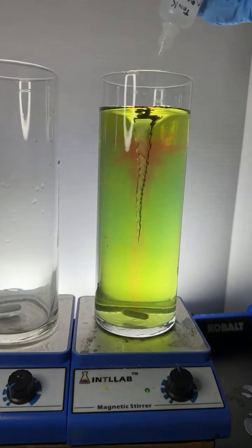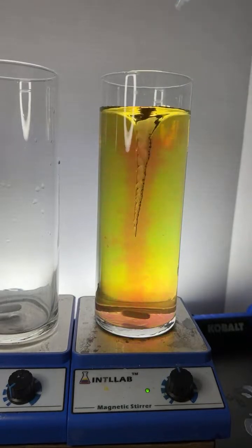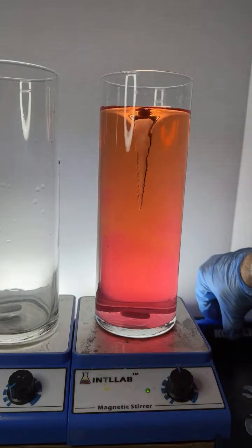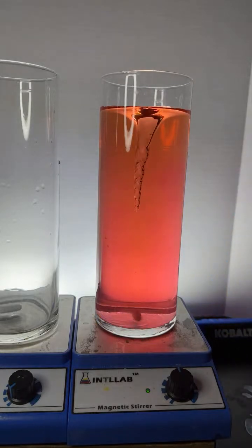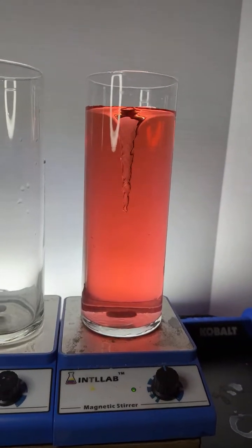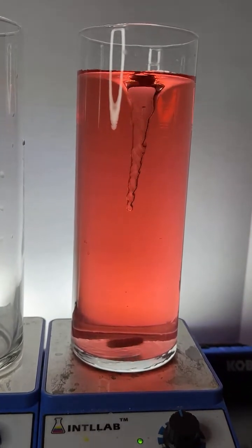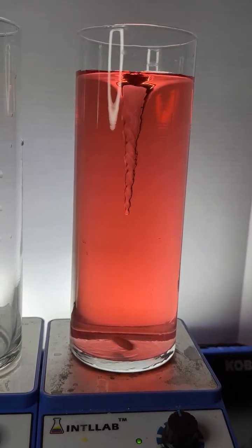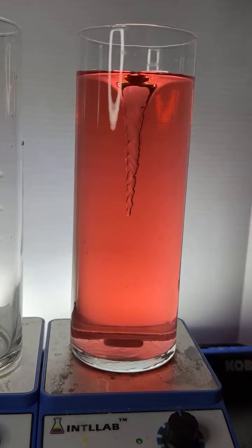Yes, they are. So you're seeing the color shifts because in this flask, there's an acid-base indicator called universal or rainbow indicator. And that acid-base indicator just changes color depending upon pH. And so I just mess around with it and see what kind of interesting effects we get. A little bit of science, a little bit of art, I guess.